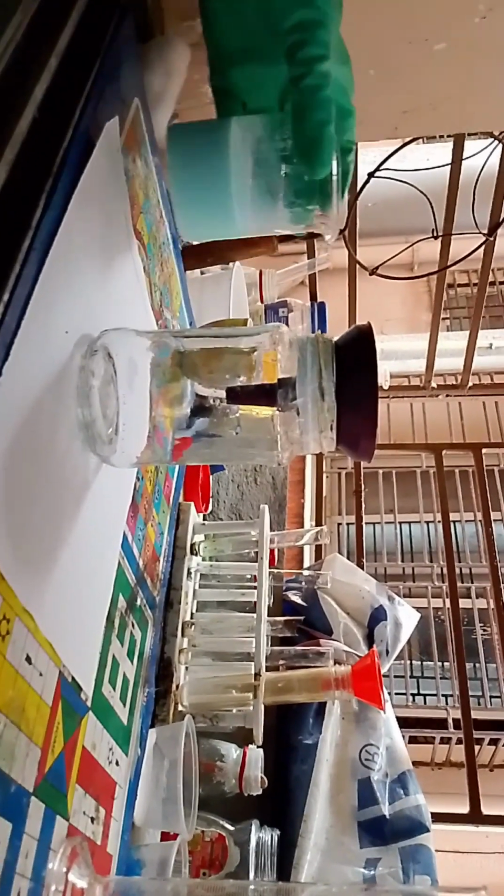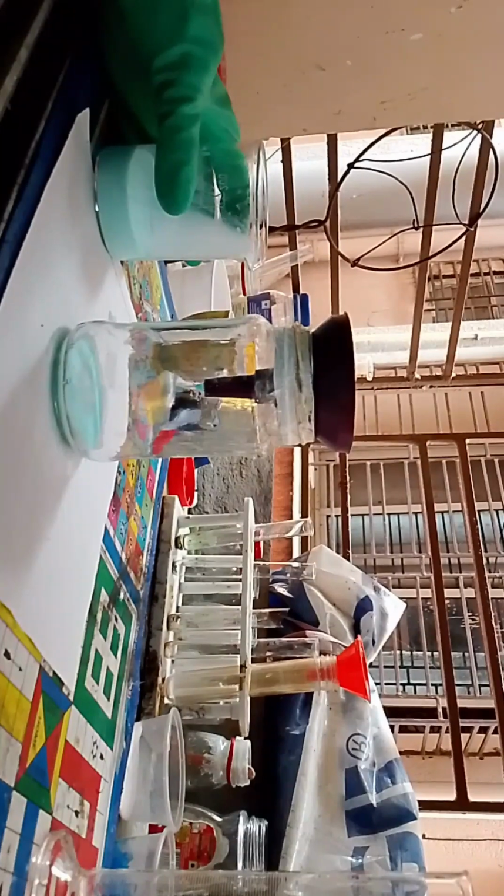Okay, as for now you can see a thin film of clear liquid forming, but we are not going to let it form for a very long time because we want to save time. Oh god, precipitate is falling down as well. Okay, first time it may occur. We need to wait a little more time. Passing it for a few more rounds will definitely clear it out.